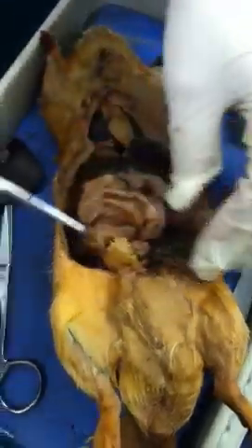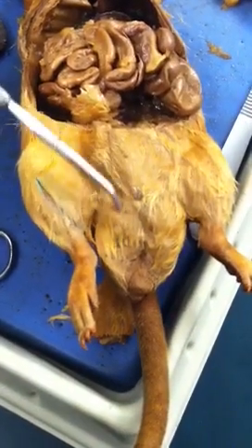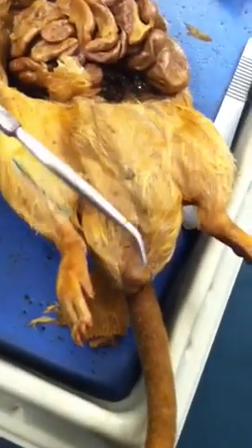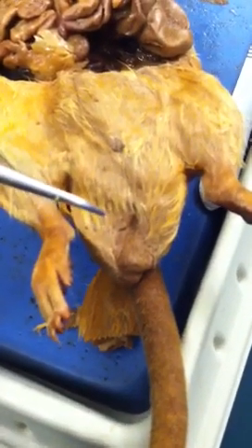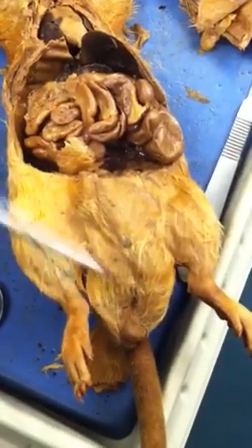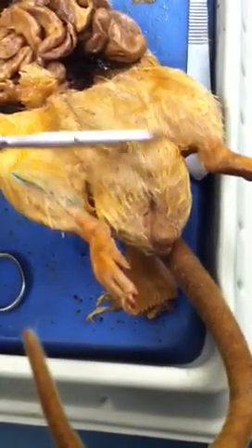Lastly, you need to know the testes. The testes are an external structure — we don't actually dissect this part, but just know if a pin is placed in this area, it's asking about testes. And you may be asked if this rat is male or female. If it has testes, that would be male.